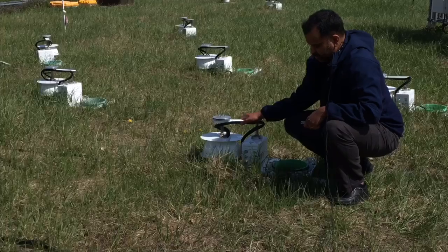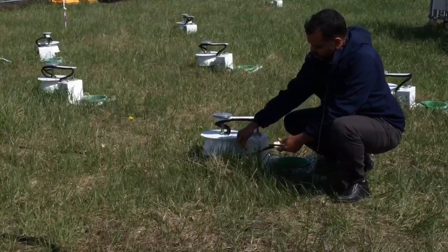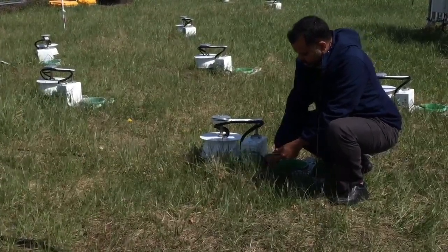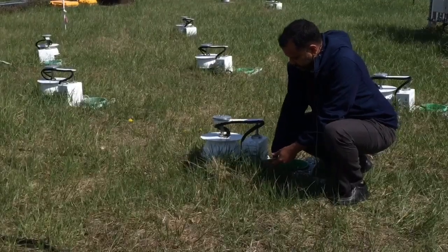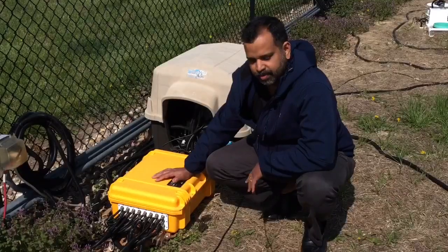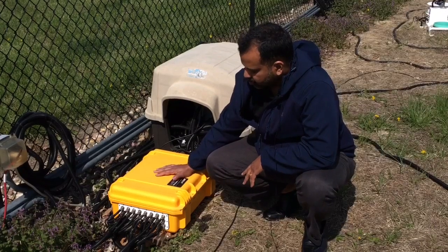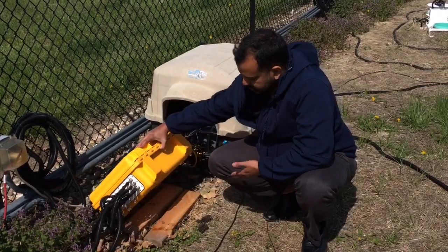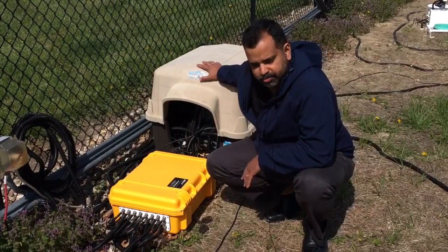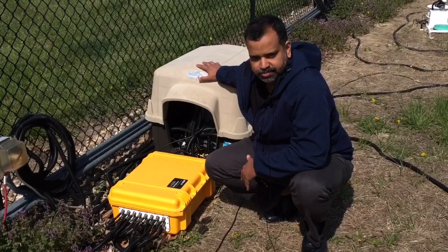Once the chamber is set up, if you have to add any other sensor like the moisture probe here, you can attach it to the chamber and then insert it directly right next to the chamber, so that we can estimate the soil moisture at the measurement site. So once you're set up with the chambers, you can set your multiplexer upon some wooden planks so that it's elevated from the surface, or you can use an enclosure like this to protect it from the solar radiation and the elements. Now we are ready to start a measurement sequence.